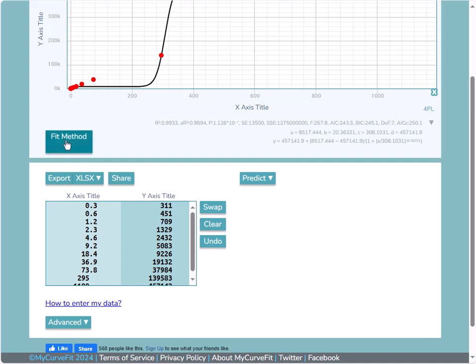In this case, if we look closer at my y-axis data, you can see that it spans a really large range, going from about 300 up to over 450,000. If your data appears to follow an expected pattern for the fit method you're using, in this case a sigmoidal 4PL fit, but the data is spread across several orders of magnitude, you may find that adding a log10 transform to the data can greatly improve the fit.